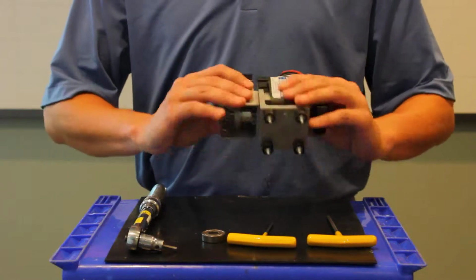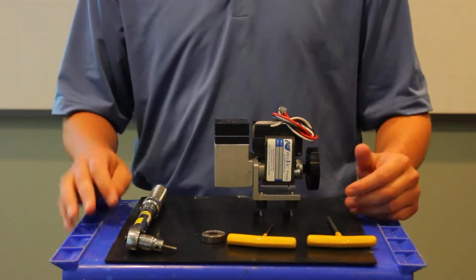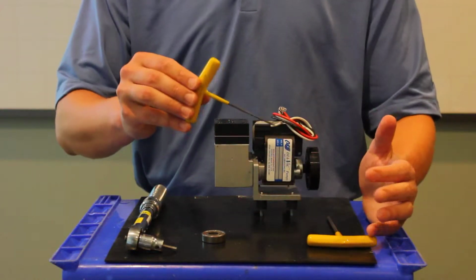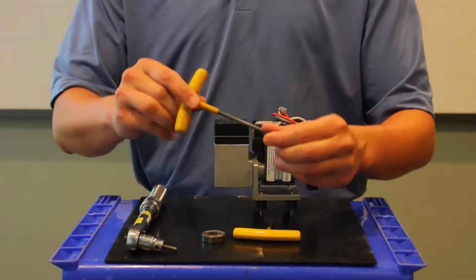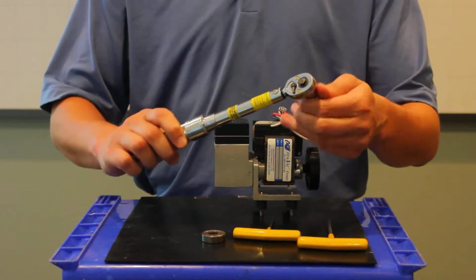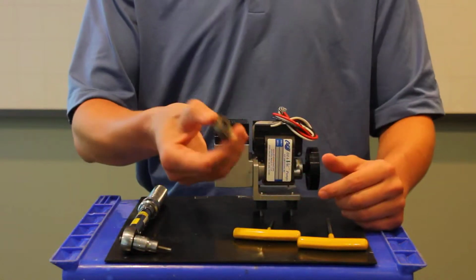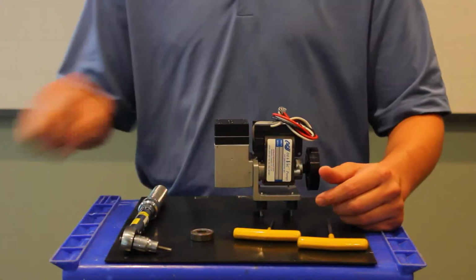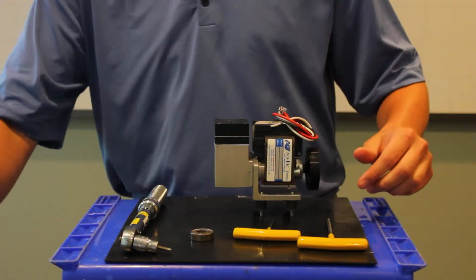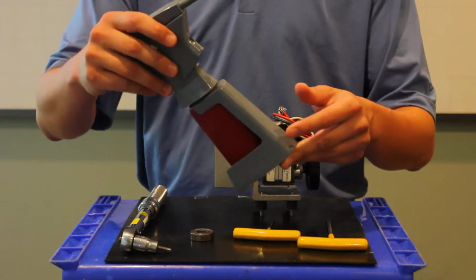So in order to change out the diaphragm on the Micro Dia-Vac pump, all we really need are a few tools. First of all, we need a 3/32 Allen key, a 5/32 Allen key, a torque wrench set to 28 inch-pounds, a round object such as a bearing or an eccentric, and a flat surface. And lastly, a medium-strength thread locker such as Loctite 242.